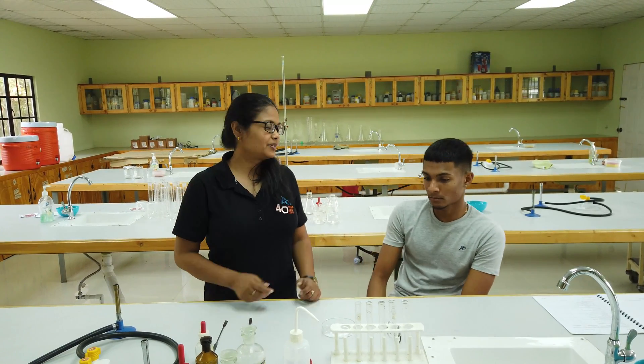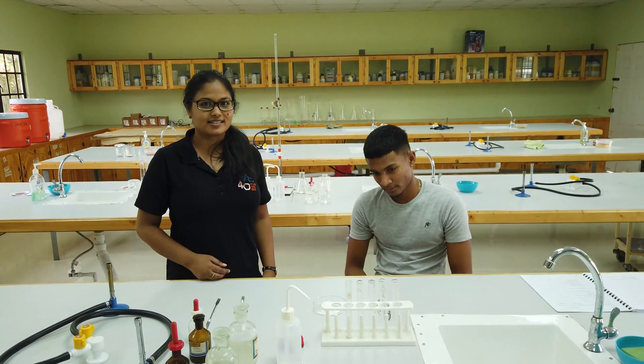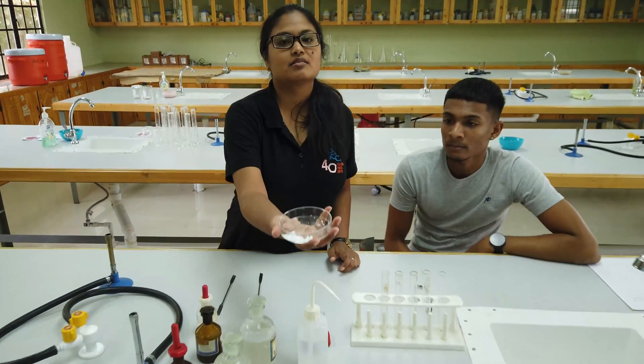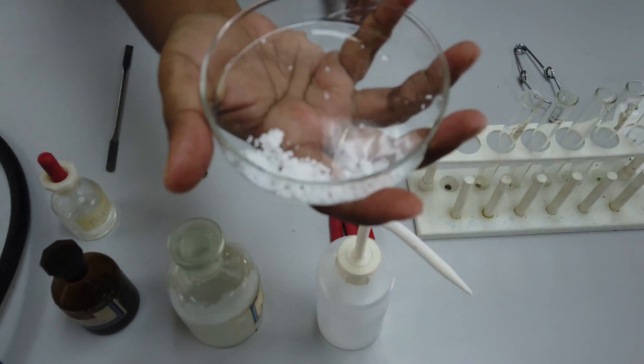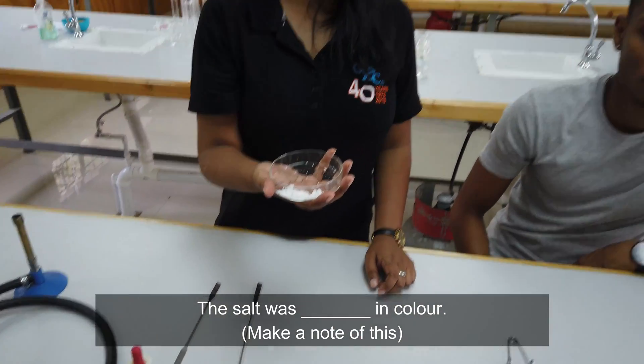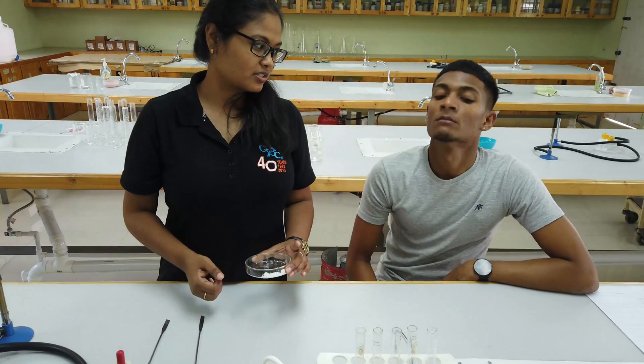Hi guys, here with Daniel again. This time we're going to do a salt analysis. Our problem is we have salt X - just note the color and state of the salt. We want to try to figure out what the salt is. It's like a CSI investigation going on here.